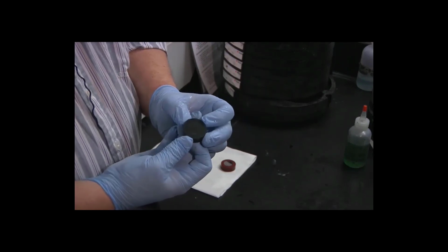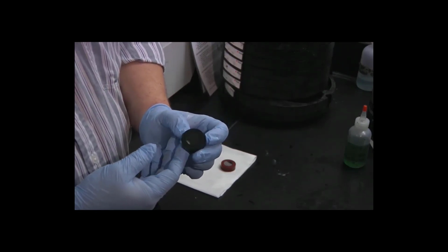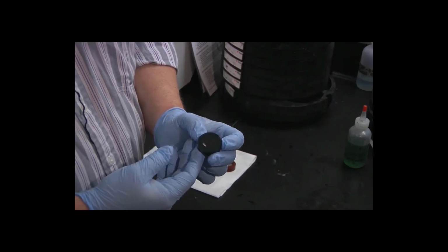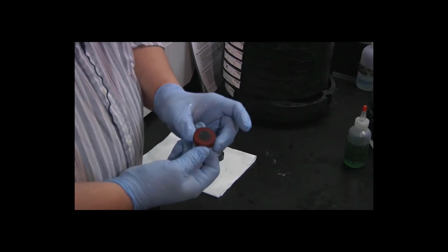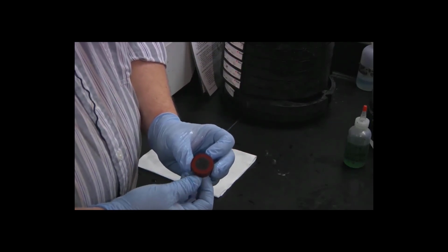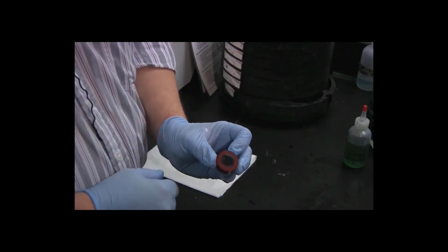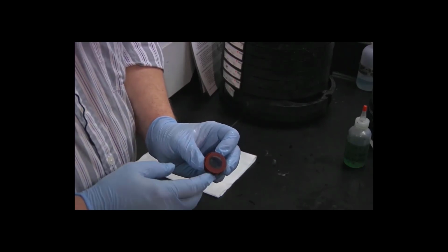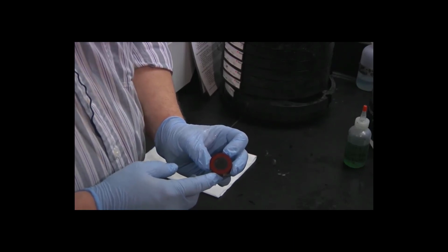Our green specimen, surprisingly, was the one that wasn't looking so good at the beginning. It actually looks really good right now. Again, there's a few scratches, but less than on the black specimen. And the red specimen, we still have that divot, same as green. There are some scratches at the very top here. There's an area of slightly worse scratches, but again, that's way off at the edge. The center is pretty good. We can definitely work with that.